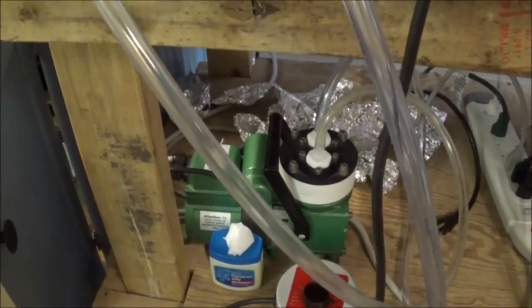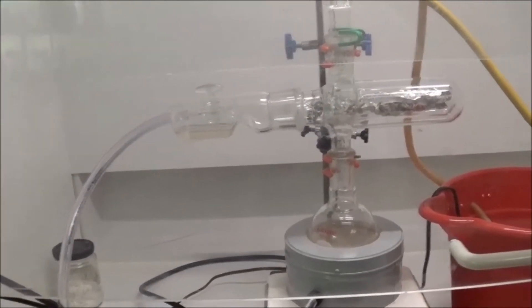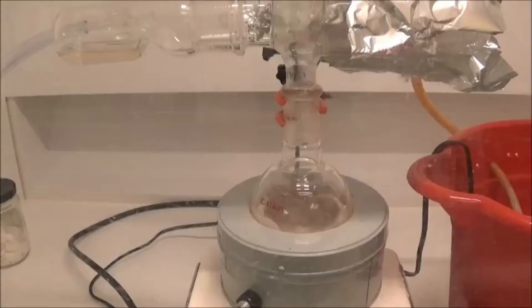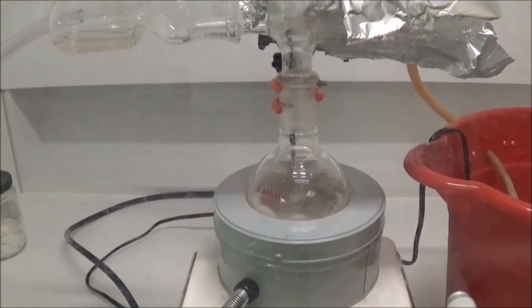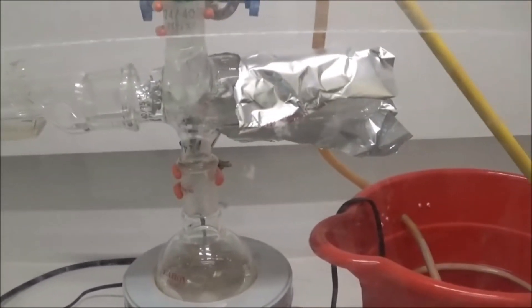Here I have run a line going to my vacuum pump. The pump is then run for several minutes to ensure that most of the air is removed. The stopcock was then turned to contain the vacuum and the sample is left to dry under heating for as long as you deem necessary.